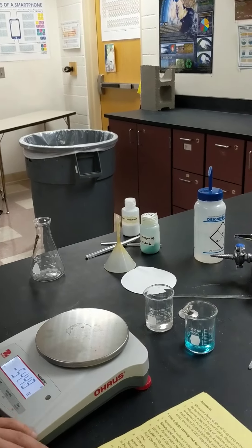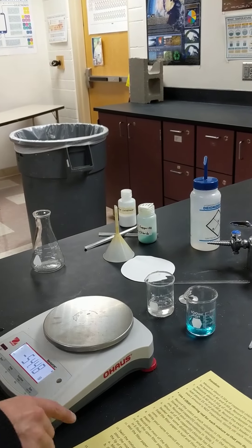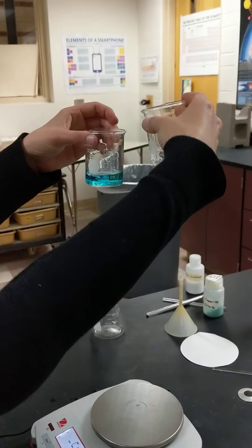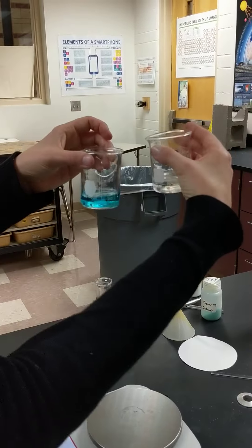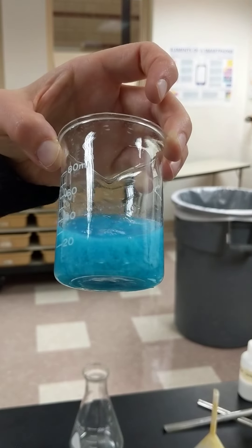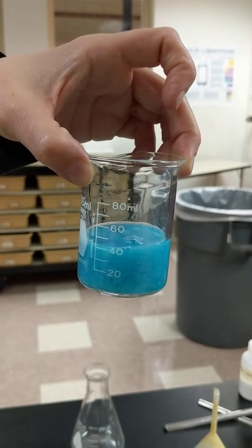So then the next thing we're going to do is we're going to mix these two together. So we're going to pour them into each other. And you can see that it got really cloudy, kind of almost lumpy.